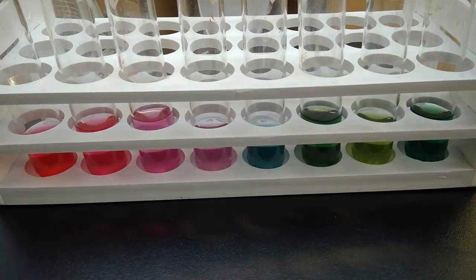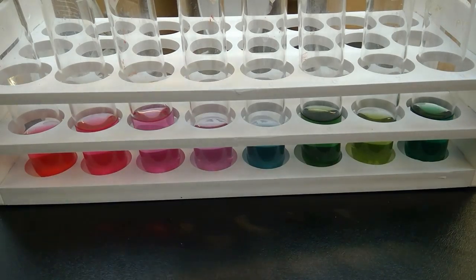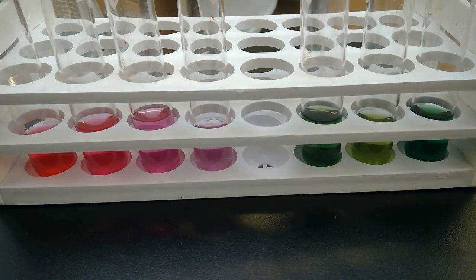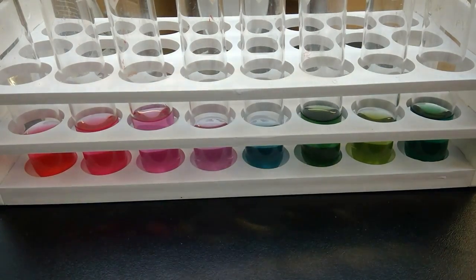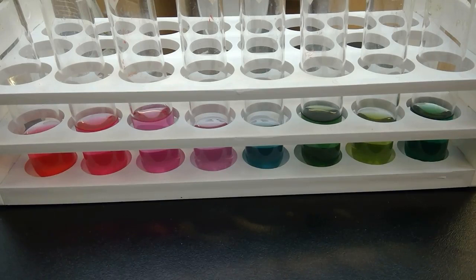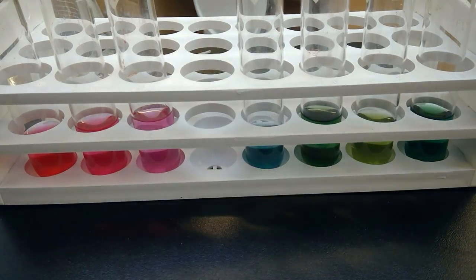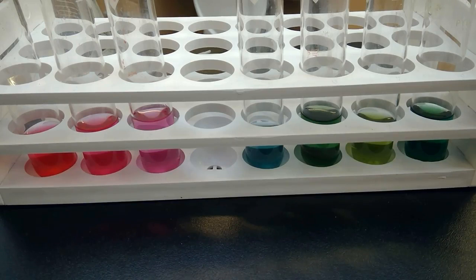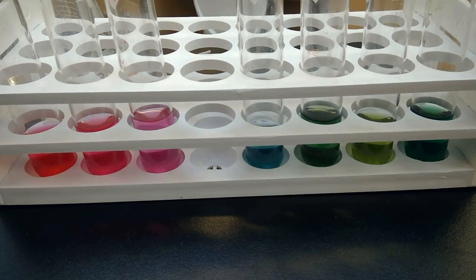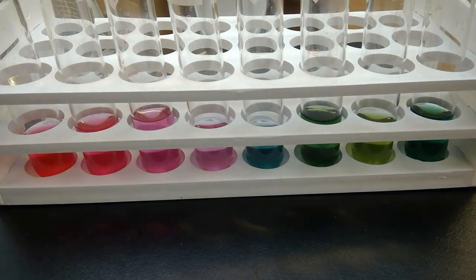We've established a set of known standards. So when we test something's pH, if it turns out to be this first turquoise color, you could infer based on comparison to this standard that the unknown solution you're testing is pH 8. If I take this 5 out and it's light purple and your unknown solution comes out light purple, even though you don't know the pH, you can infer it's pH 5. So we're establishing a standard for comparison of unknowns.